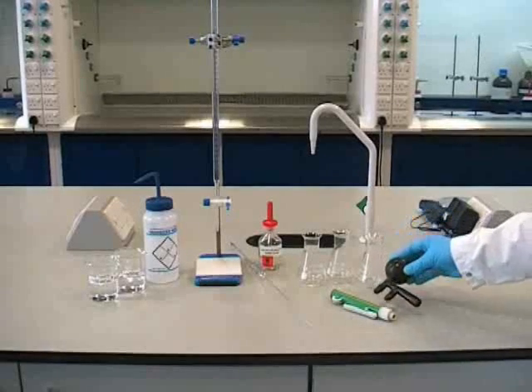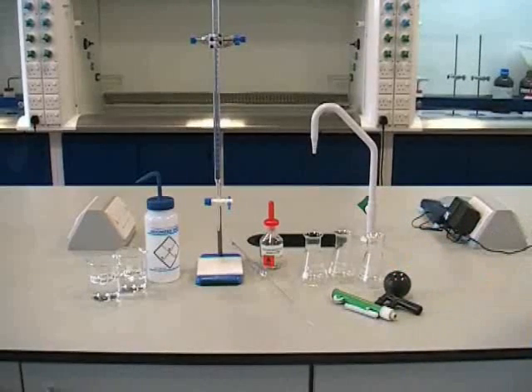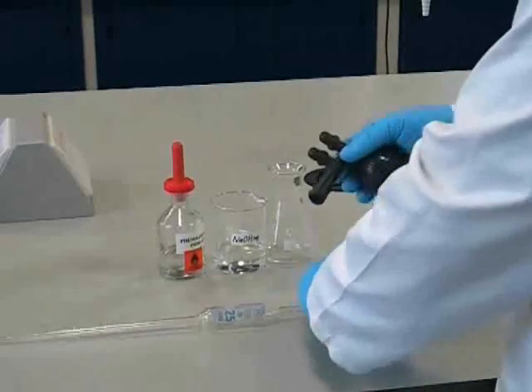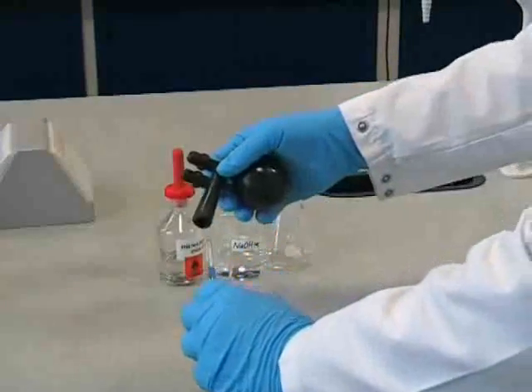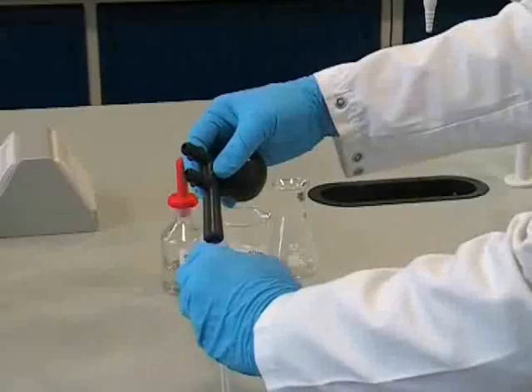Here we're going to use a more traditional rubber bulb pipette filler, which should be attached carefully to the end of the pipette. It's important to hold the pipette close to the end attached to the pipette filler to reduce the risk of breakage.